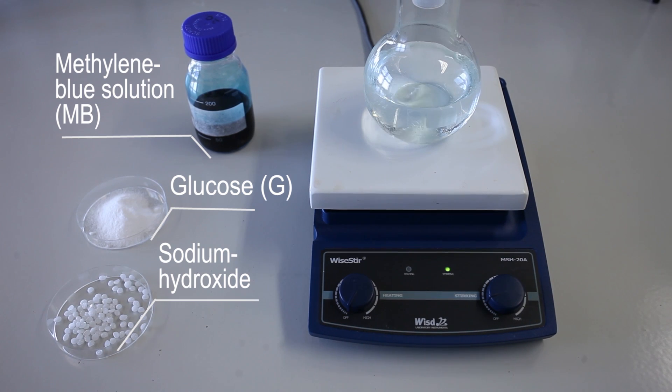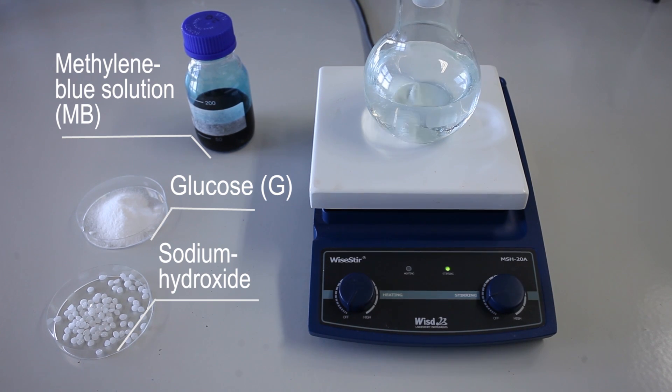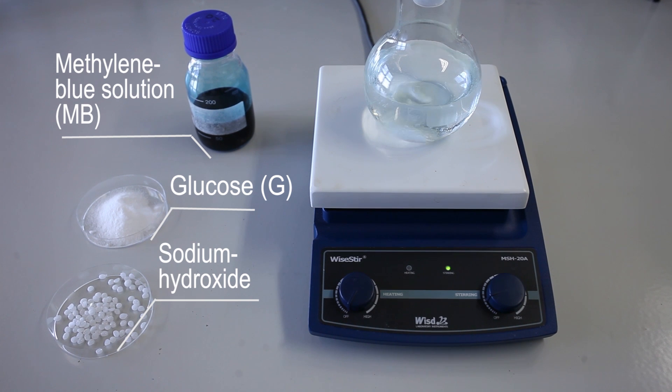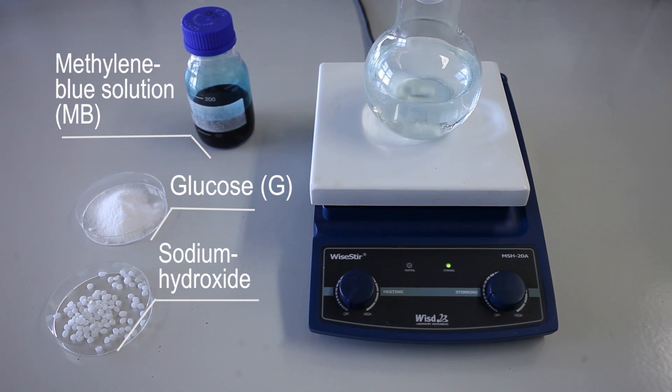For the blue bottle experiment, we need glucose, sodium hydroxide, and a methylene blue dye stock solution.